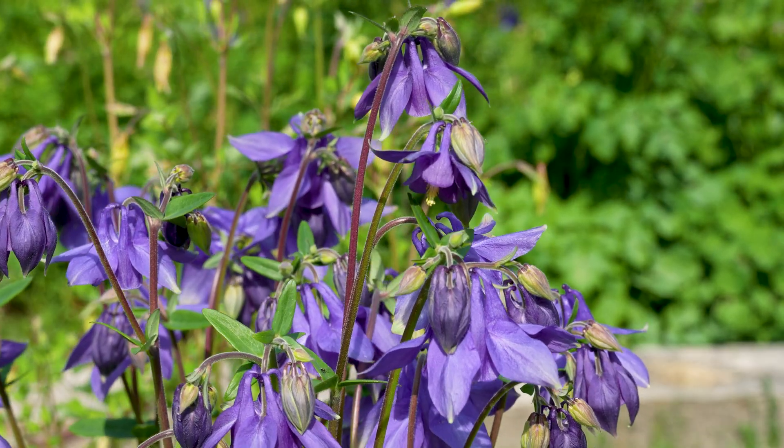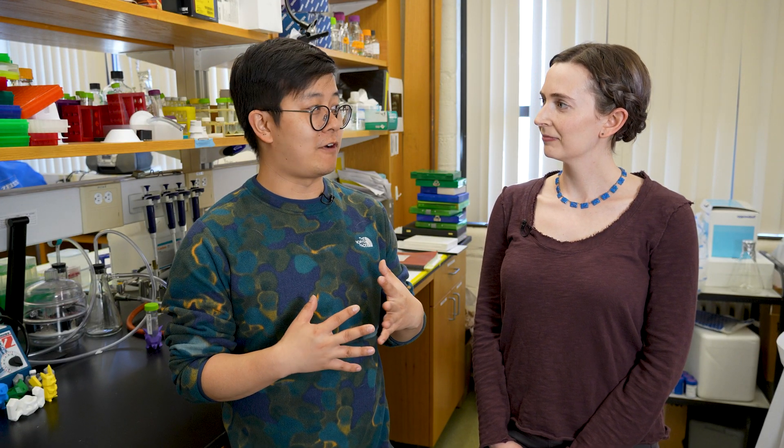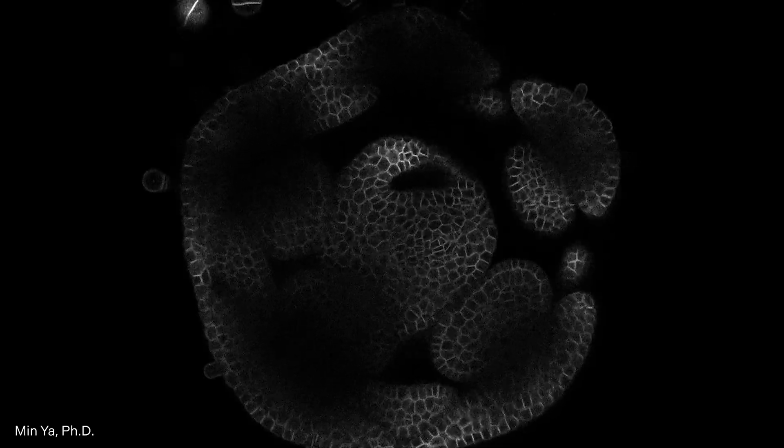So Yan, can you talk a little bit about why we want to change columbine flower genes in the first place? So we're in a basic science lab, so we really care about how fundamental aspects of plant development work, like how a flower is able to control the shape and color of all their different organs. In order to understand that, we first need a couple of functional tools. One is to be able to visualize how the cellular dynamics are — to watch the dynamics under the microscope. We would basically need a marker to track the cells over time. You want to be able to light up the cells so we'd be able to know what every single cell in the plant is doing as it makes a flower. Exactly, that's the ultimate goal.